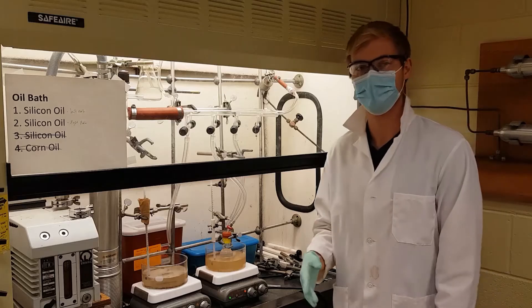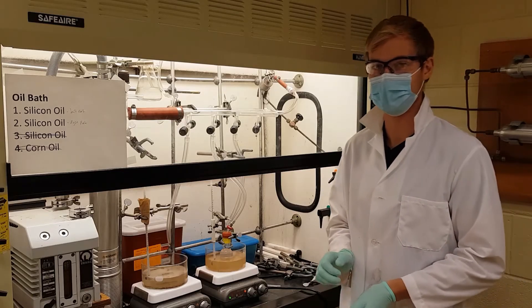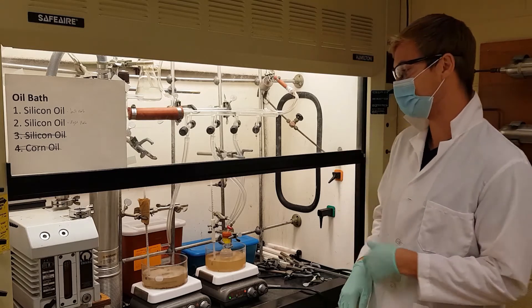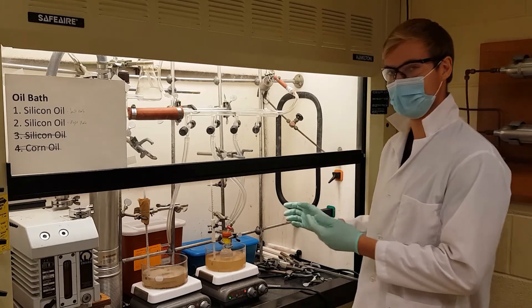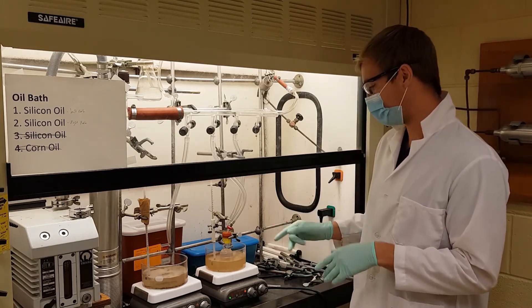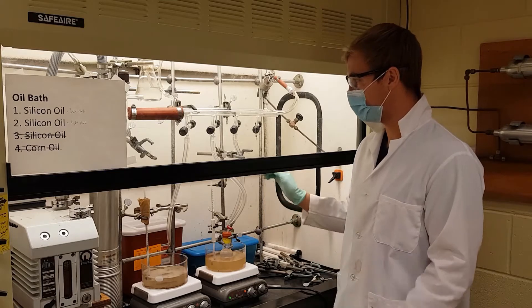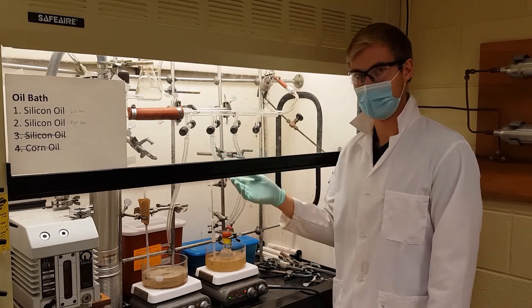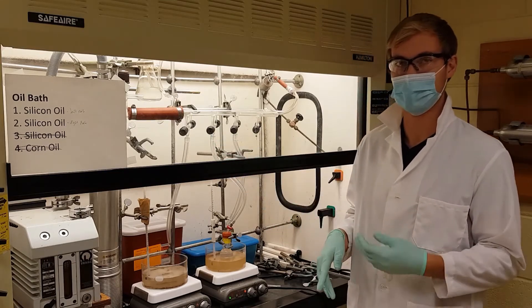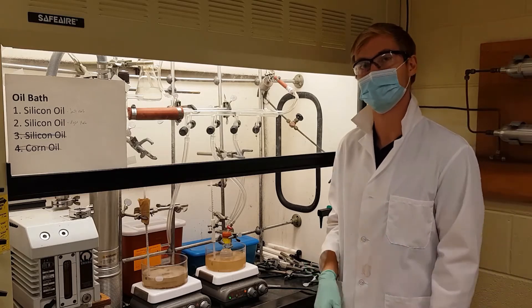Our research first starts by synthesizing our polymer materials. In order to do that, we utilize the Schlenk line as shown here. The Schlenk line allows us to alternate between vacuum and inert nitrogen gas, which creates optimal reaction conditions for polymer synthesis.